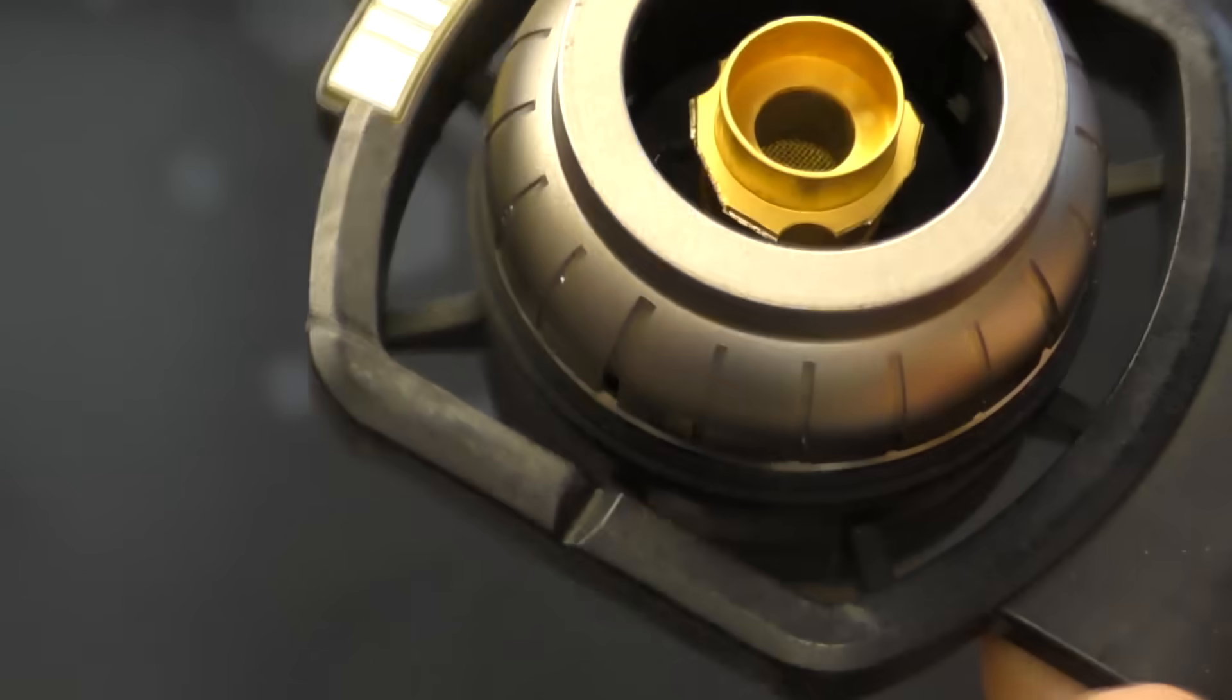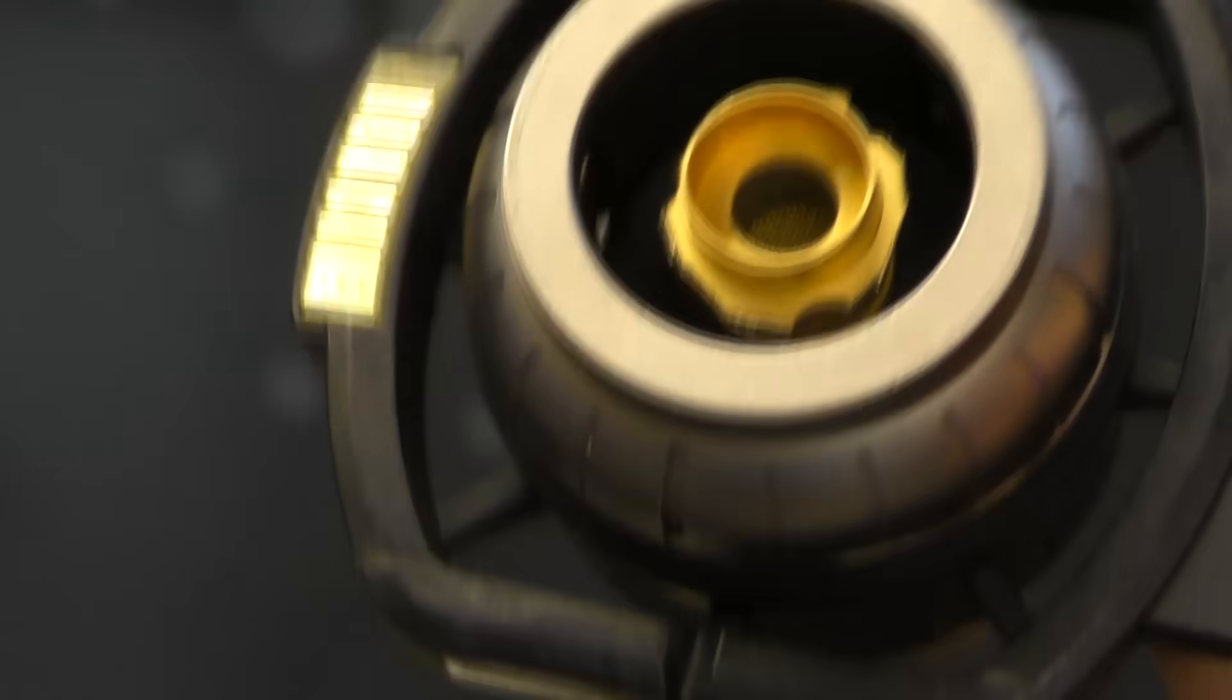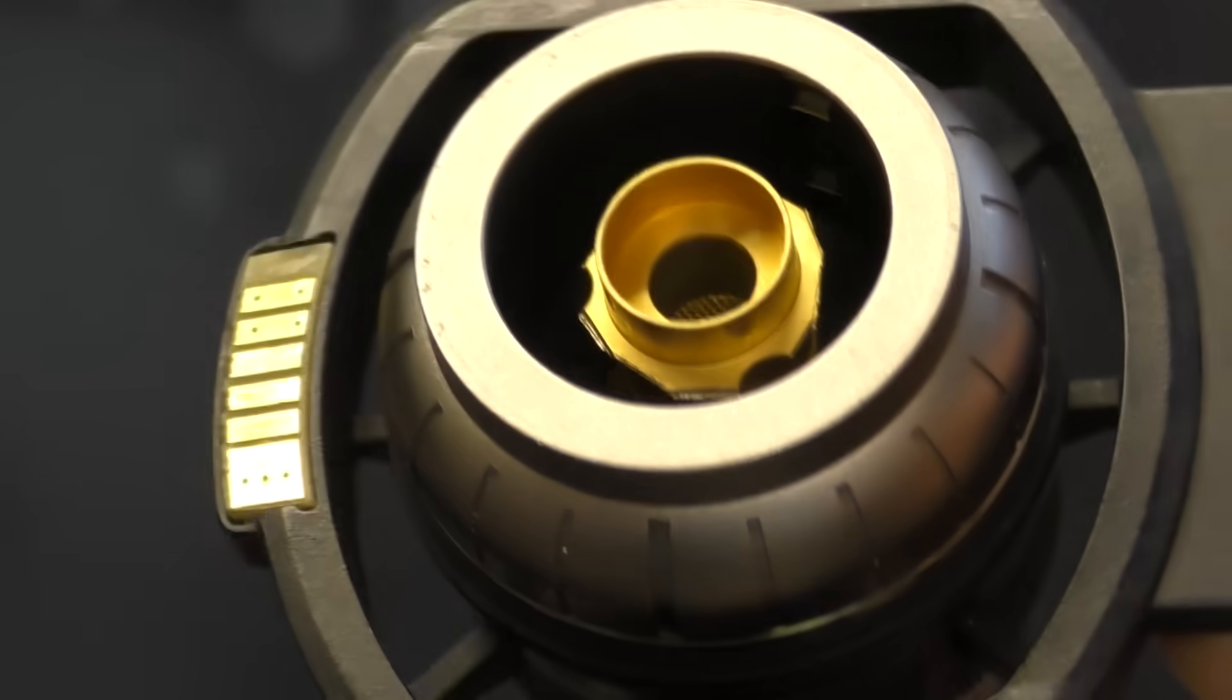Now the noise and the lack of current is pretty much the smoking gun in terms of a dead filament. Obviously we're not getting any signal at all. But I'm wondering if we can get any signal from the nickel-63 source from the substance sniffer.